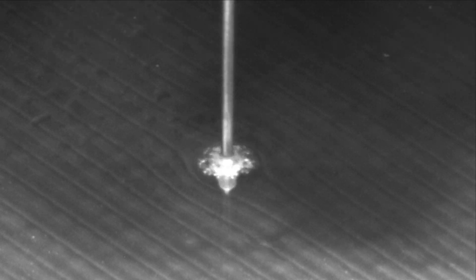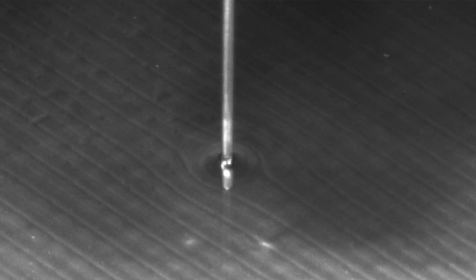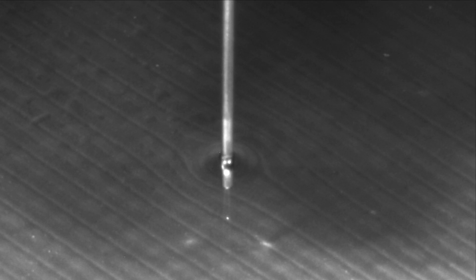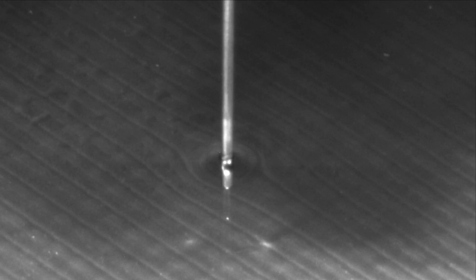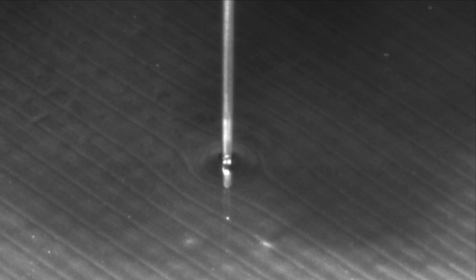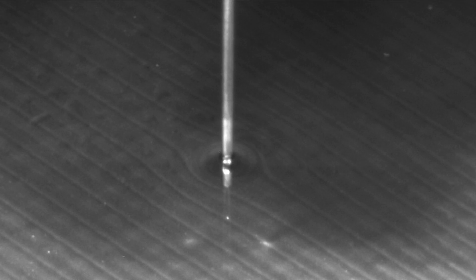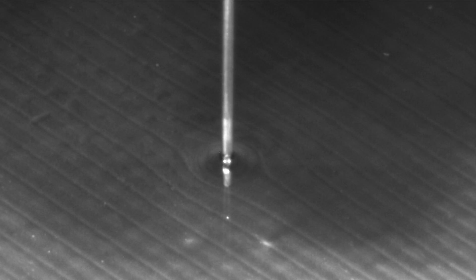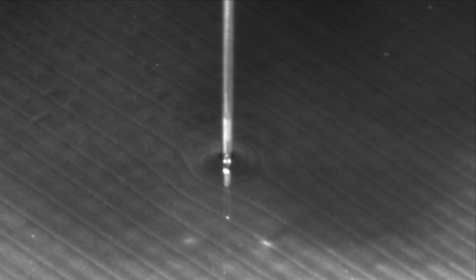In the second macro video, I tapped the table to break the meniscus at the tip, giving a better view of the etching. However, this process produces a terrace-like etching that is also similar to what happens when bubbles or debris gets stuck on the tip during the etching.